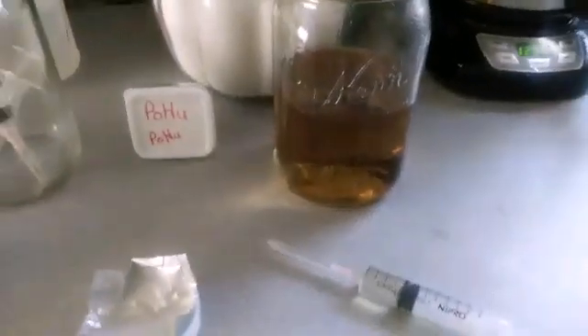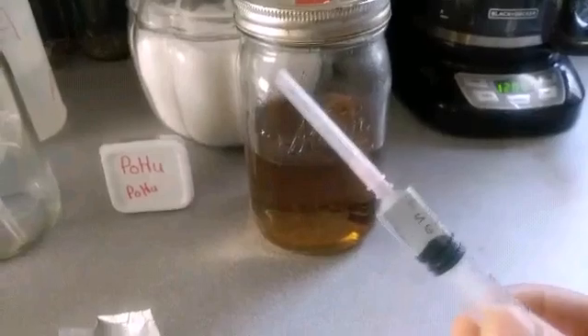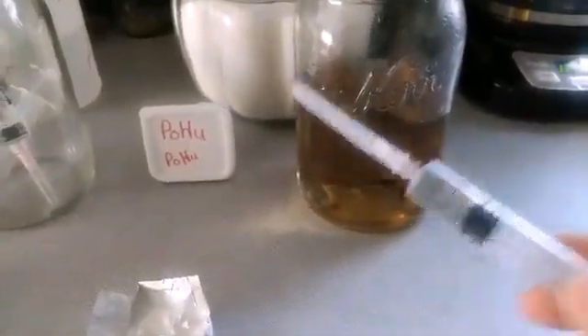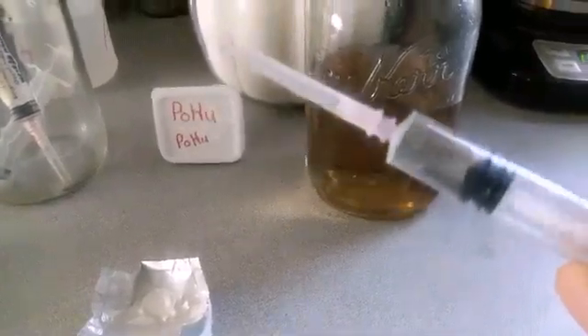What I did was grab one of my old syringes from a recent order and sucked some fluid out already — just a little bit, no specific measurements. It's at four cc's right now. I already stuck my spore print — it's already on the foil.